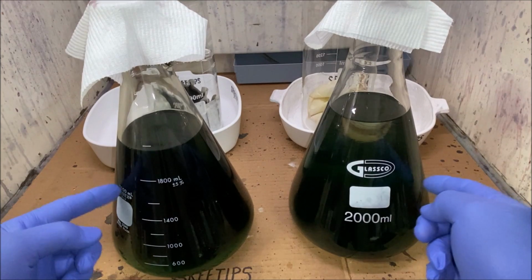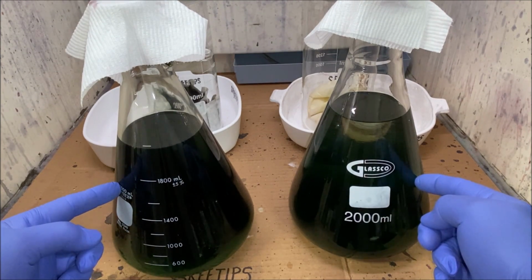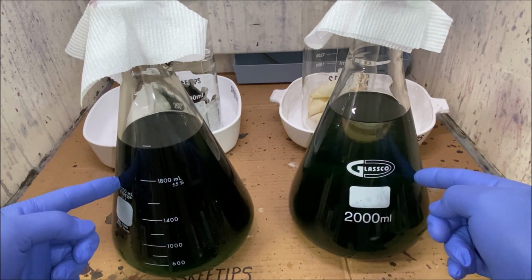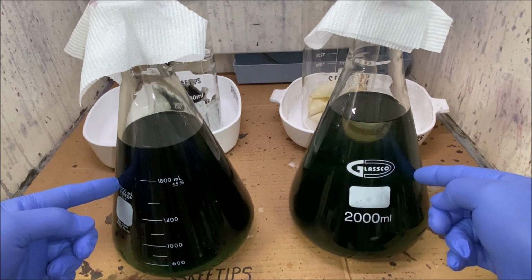I'll add this solution that's going to contain mostly silver into the cementation bucket. Any gold or platinum group metals will cement out onto the copper. I won't lose them. I'll get them back when I melt that cement silver into granules and run it back through my silver cell.